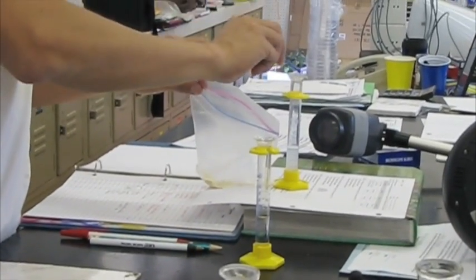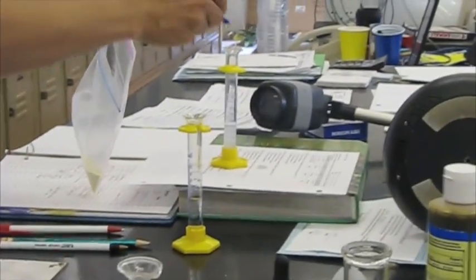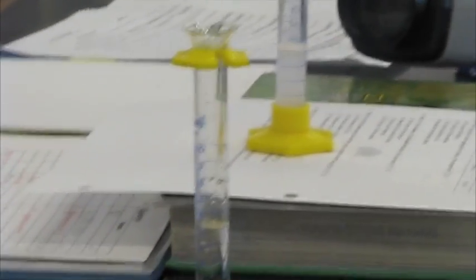So if I put one scoop, two scoops. If I put two scoops in the saliva, how much should I put in the water? Two. Two scoops. Because what variable is that? Control. Control variable. Very good. Two scoops.